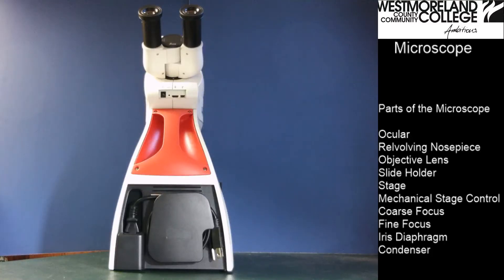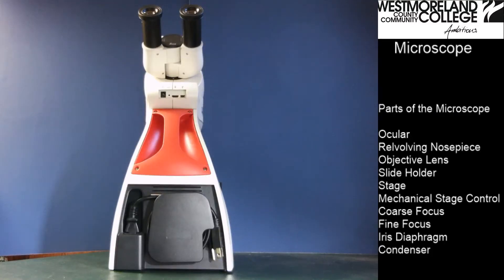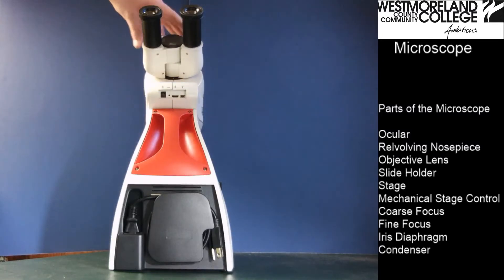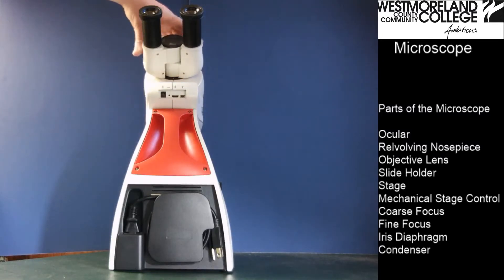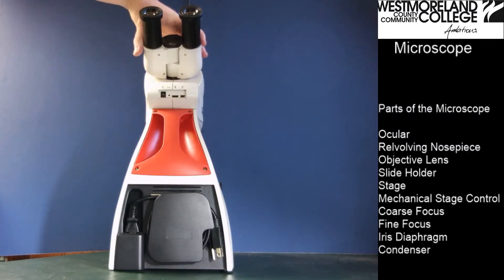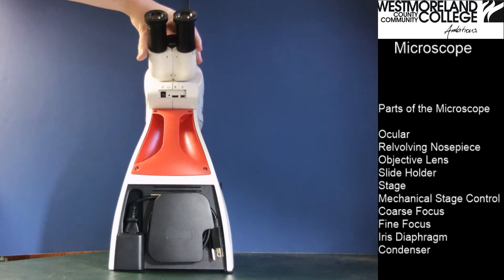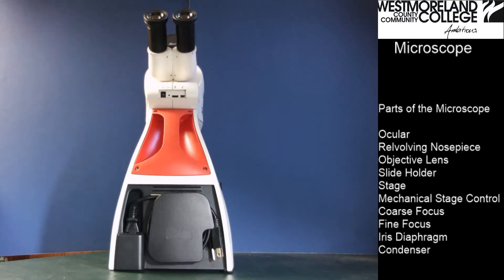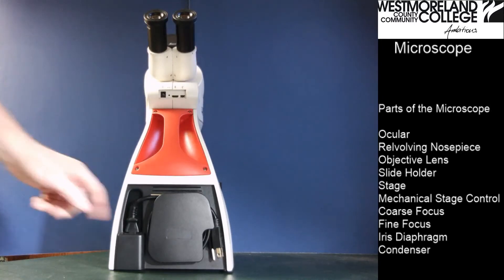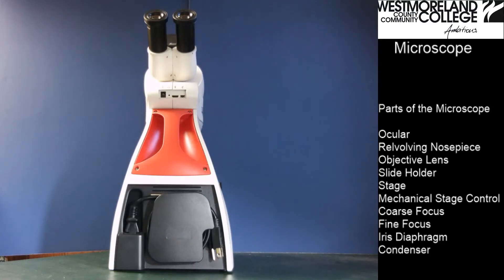In this video we will look at the parts of the microscope. Starting from this view we can see the oculars, which can be moved to the distance of your pupils. We can also see the power cord, which is currently wrapped up at the moment.